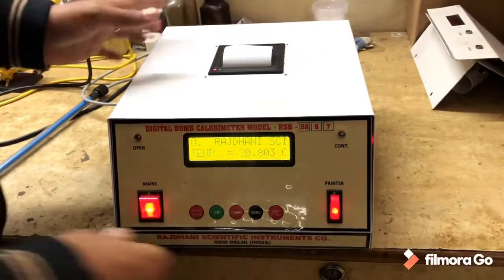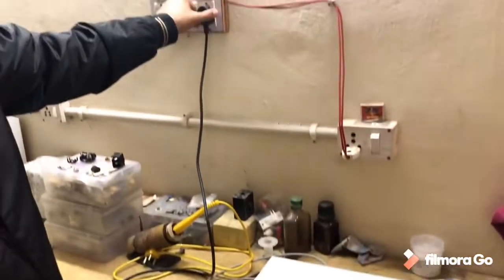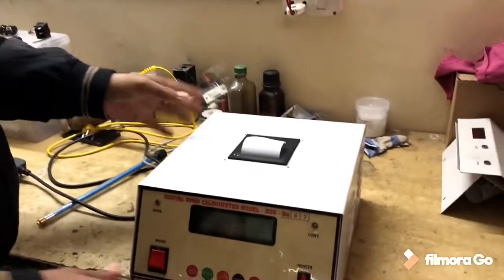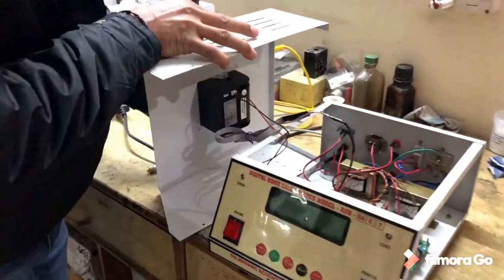To replace this printer, first we have to switch off the machine and take out the 3-pin plug from the wall. This is most important for precaution. Now after opening these screws, we will just lift the top panel and put it aside like this.